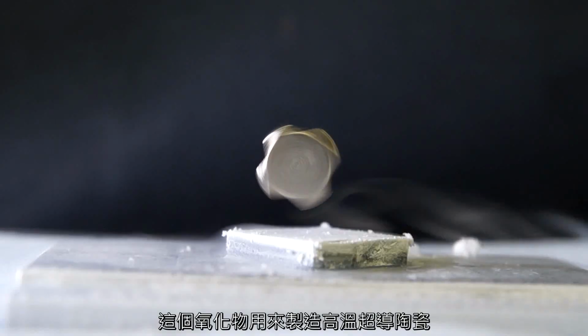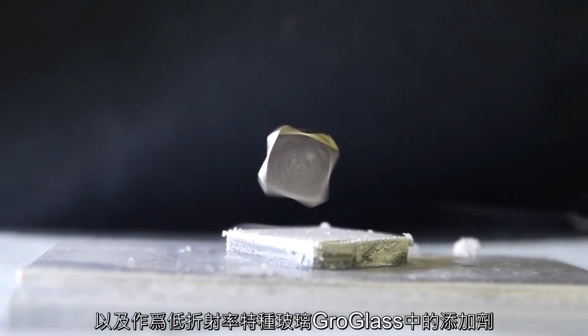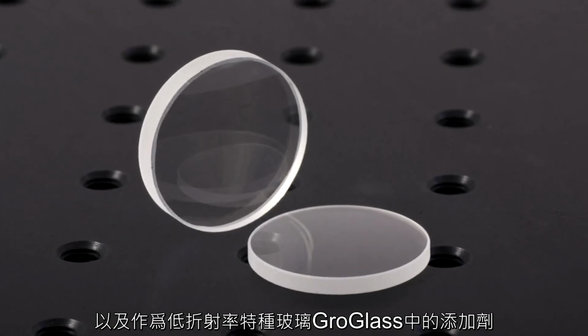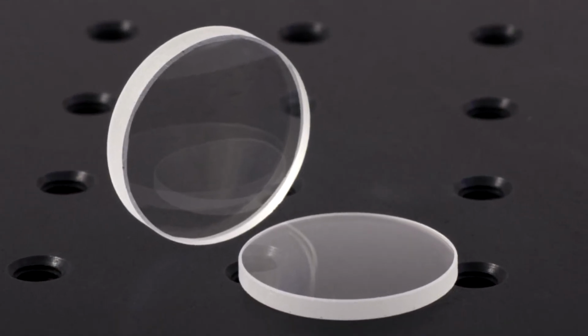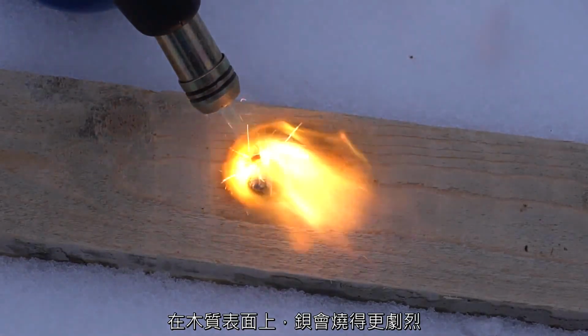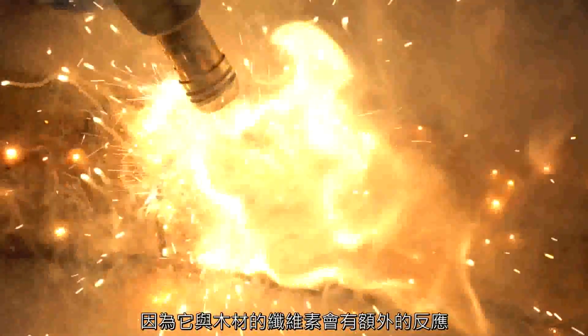This oxide is used to create high-temperature superconducting ceramics, as well as an additive in specialty glass with a low refractive index. On the wooden surface, barium burns more intensely because of an additional reaction with the cellulose from wood.